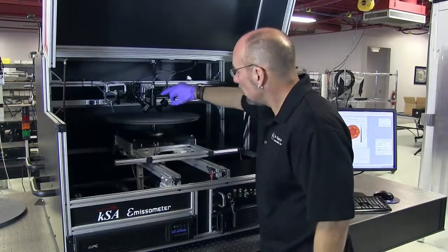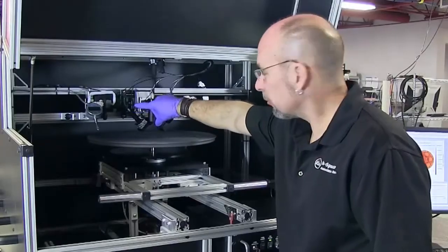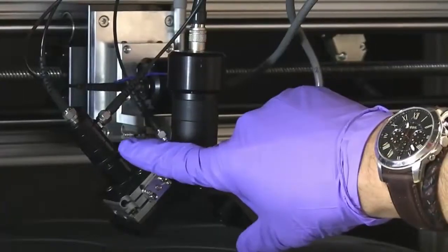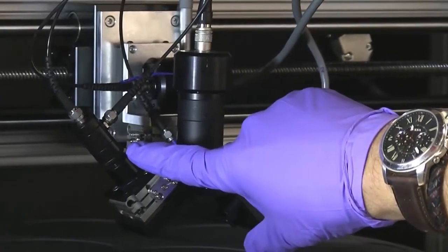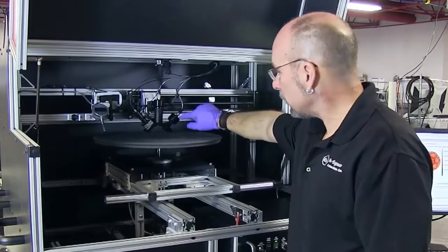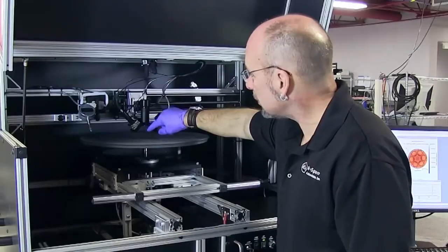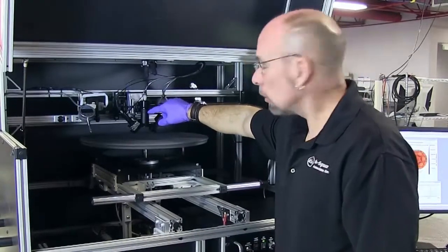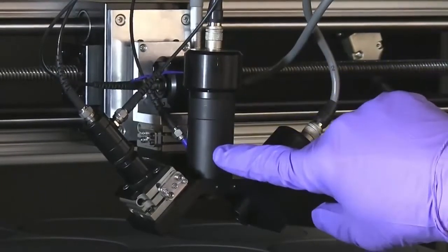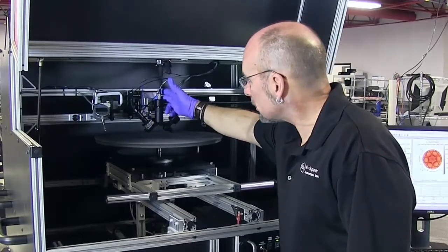The principal operation of this tool is we bring in typically 940 nanometer light from an LED on the input lens. That 940 nanometer light then reflects and scatters off the carrier. We look at both the specular reflection at a 45 degree angle — that's what this detector detects — and we also look at the diffuse light scattered at normal and close to normal incidence, which is what the center lens cell detects.